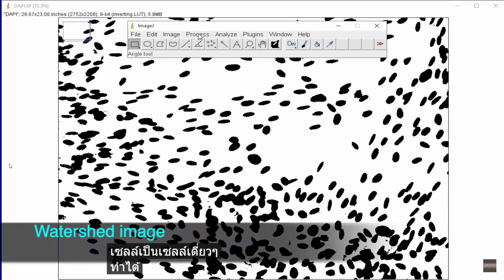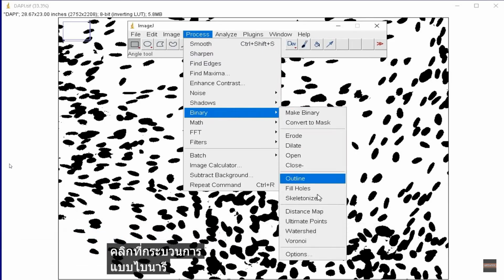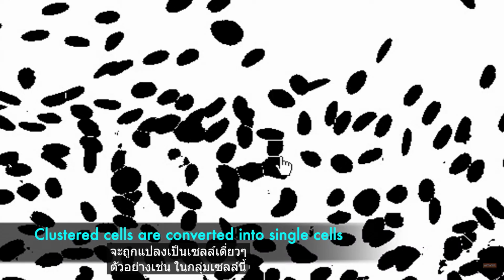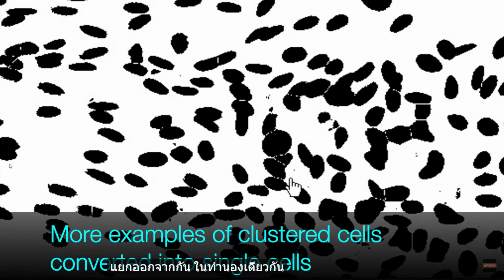This is achieved by watersheding the image. To do this, click on Process, Binary, and Watershed. Now, the clustered cells are converted into individual cells. For example, in this group of cells, white lines have been created by watersheding that splits the cells and separates them from one another. Similarly, the rest of the clustered cells are also separated.